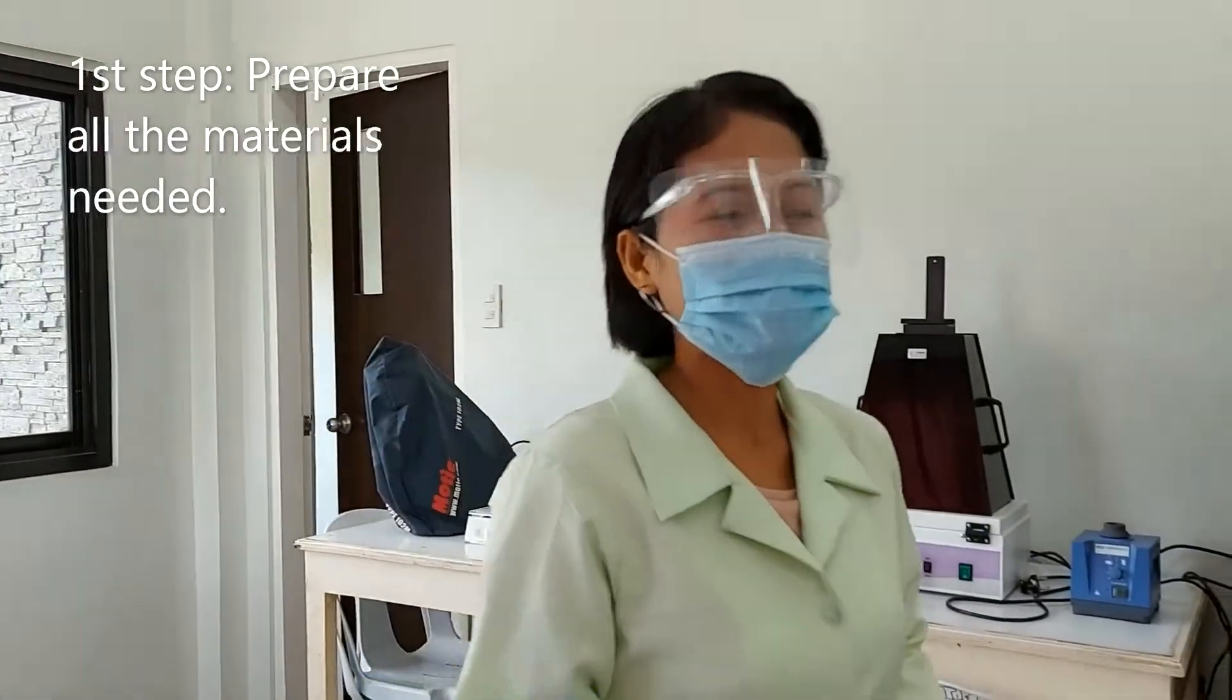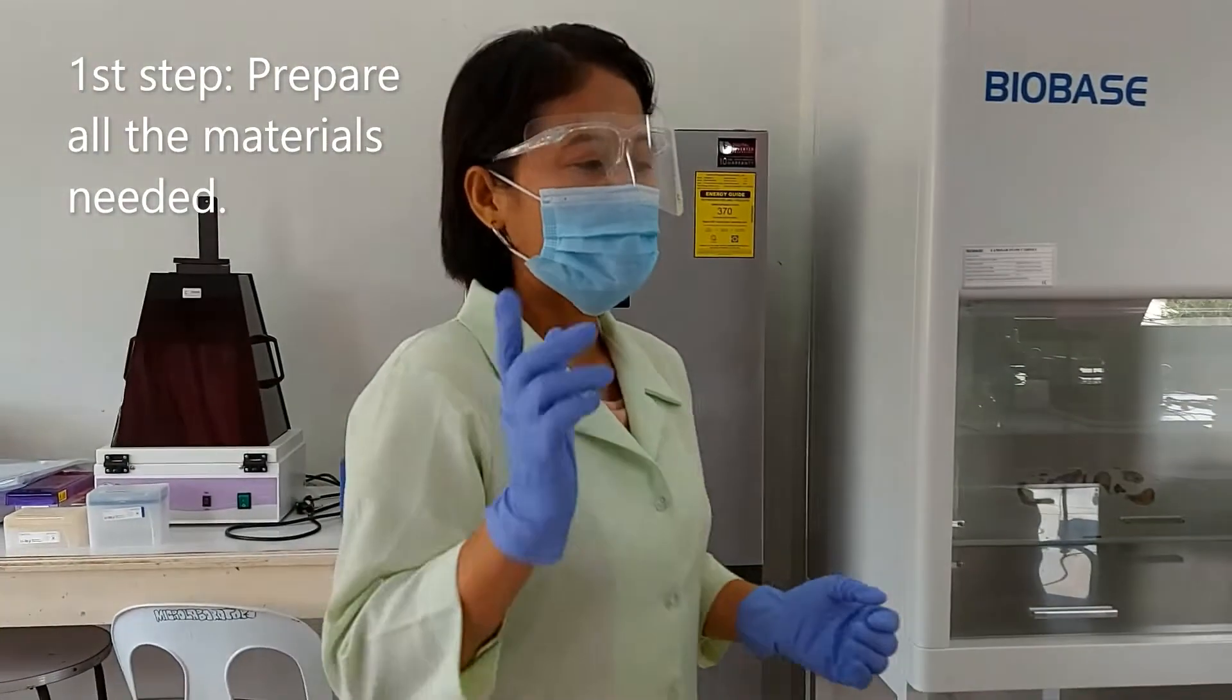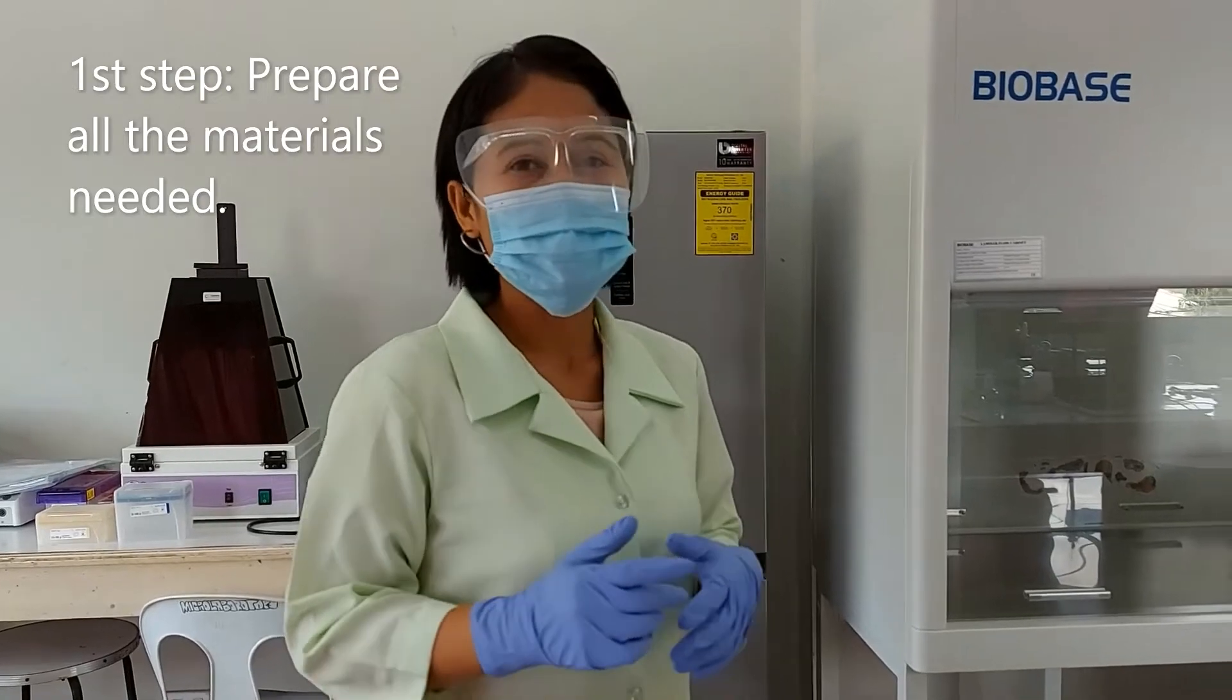Okay, so the first thing that we are going to do is to prepare the things that we need.